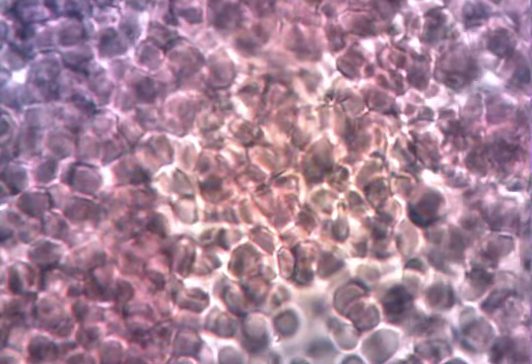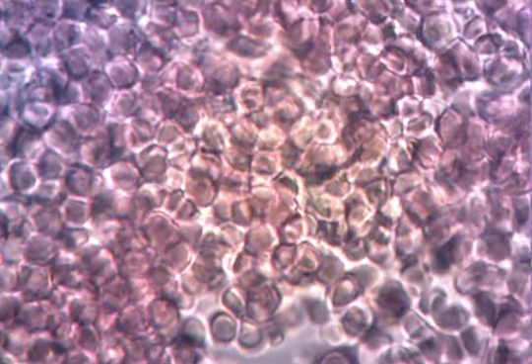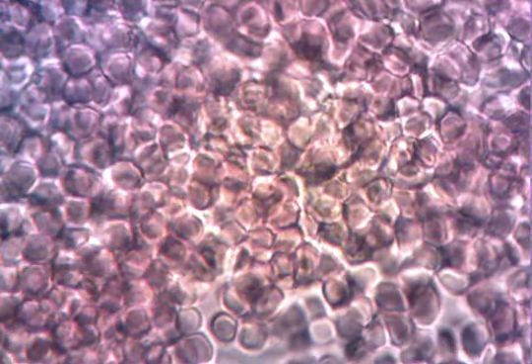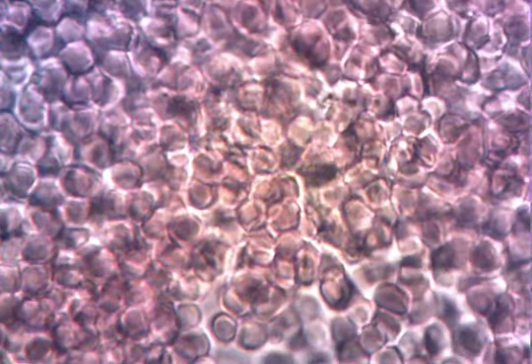Now I'm going to shift to 400. That's at 100 times magnification. Let's try 400. Whoa. Those look like hexagons. Yeah, they're kind of see-through. They're like roly-polies. They do look like roly-polies. And do you notice a difference in shape? They're big. Already you can see they're puffing up.